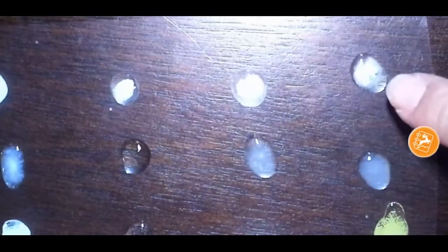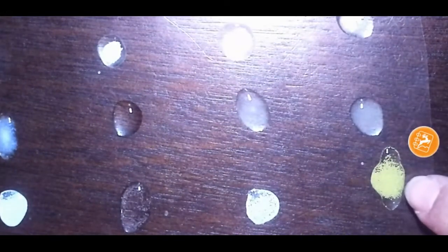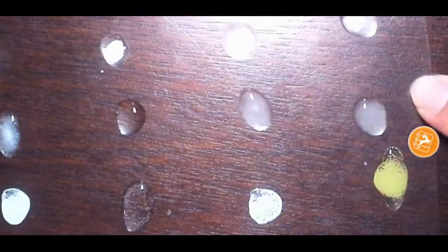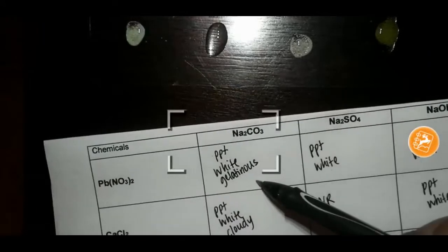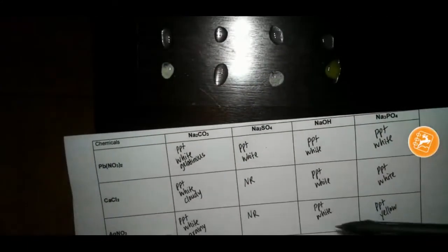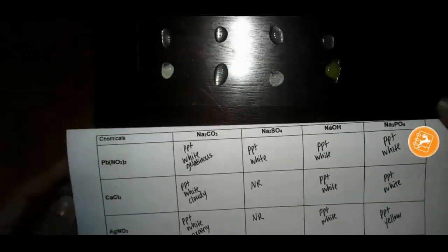So you can kind of see how this one's staying together. I can definitely see little grainy particles in that one. This one almost just looks like a film, like a cloud. When it comes to these descriptive terms, what I'm looking for is, do you have three things or no reaction? No reaction just has one thing. So you should have added another descriptive term here to these and to these. If you need to go back and look at the video, that's what you want to do.